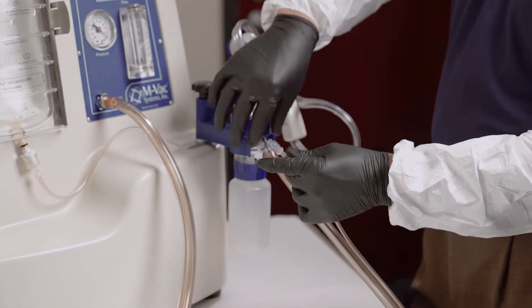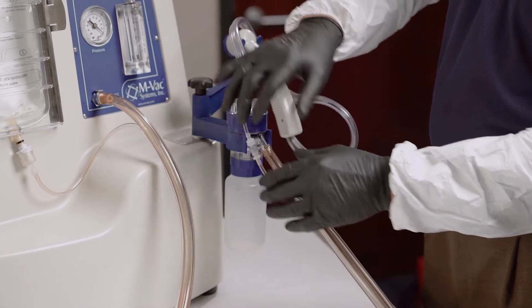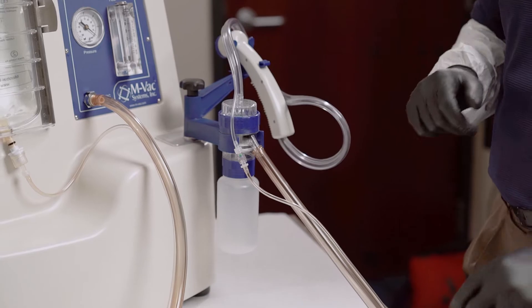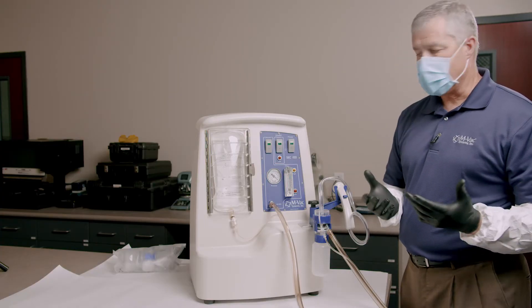During the demo it's not necessarily that important, but I'll make all these connections here so that my solution line is connected all the way to the end. And that's it — we are basically set up now and ready to go.